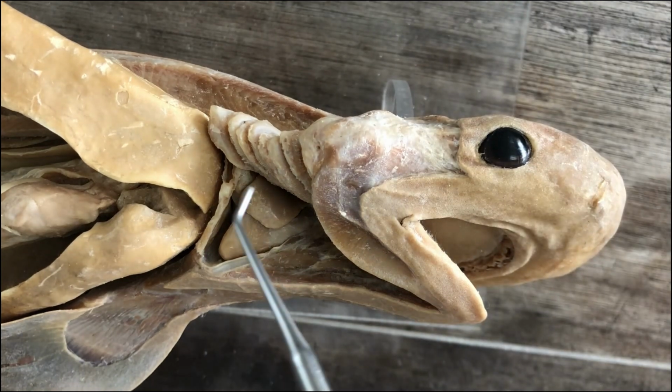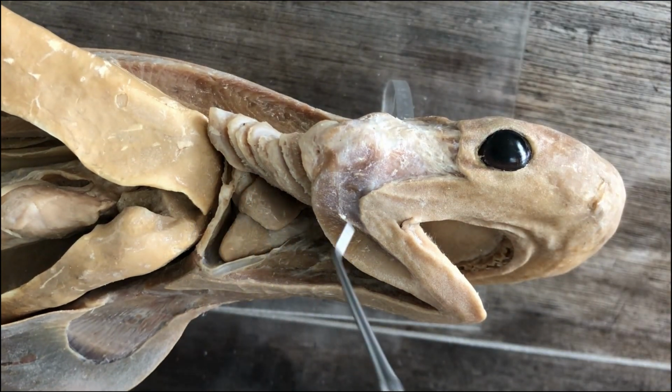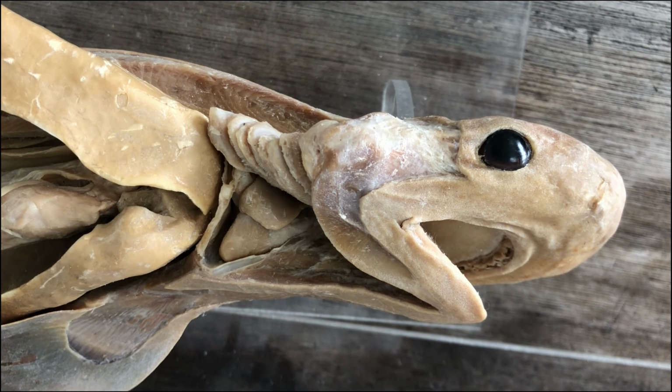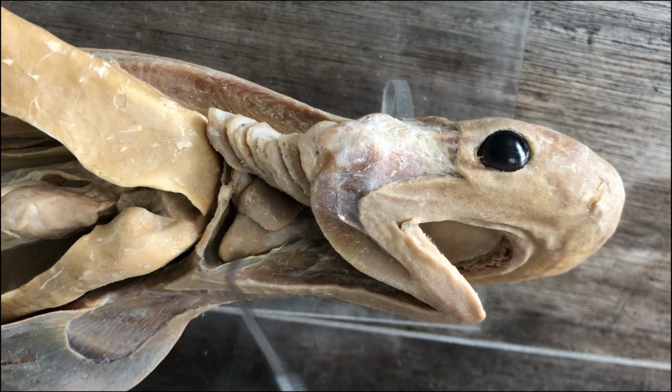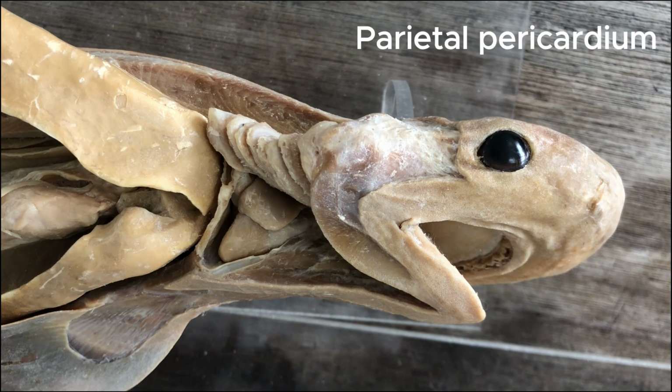And the outer coelomic membrane is referred to as the parietal blank. So if you're talking about the outer covering of the pericardial cavity, it's called the parietal pericardium.